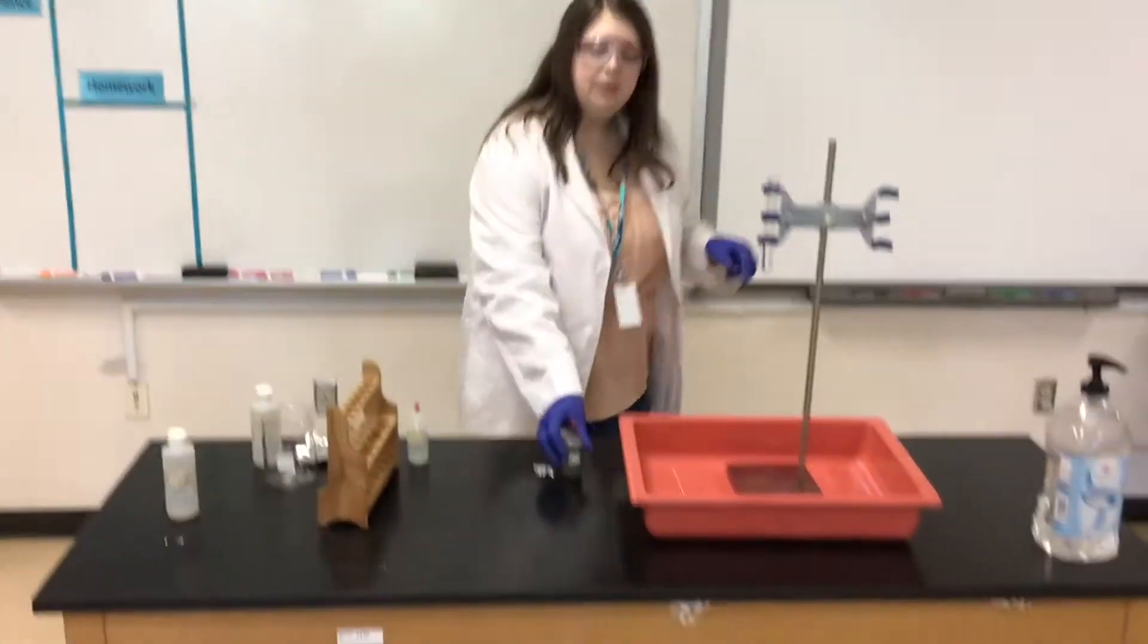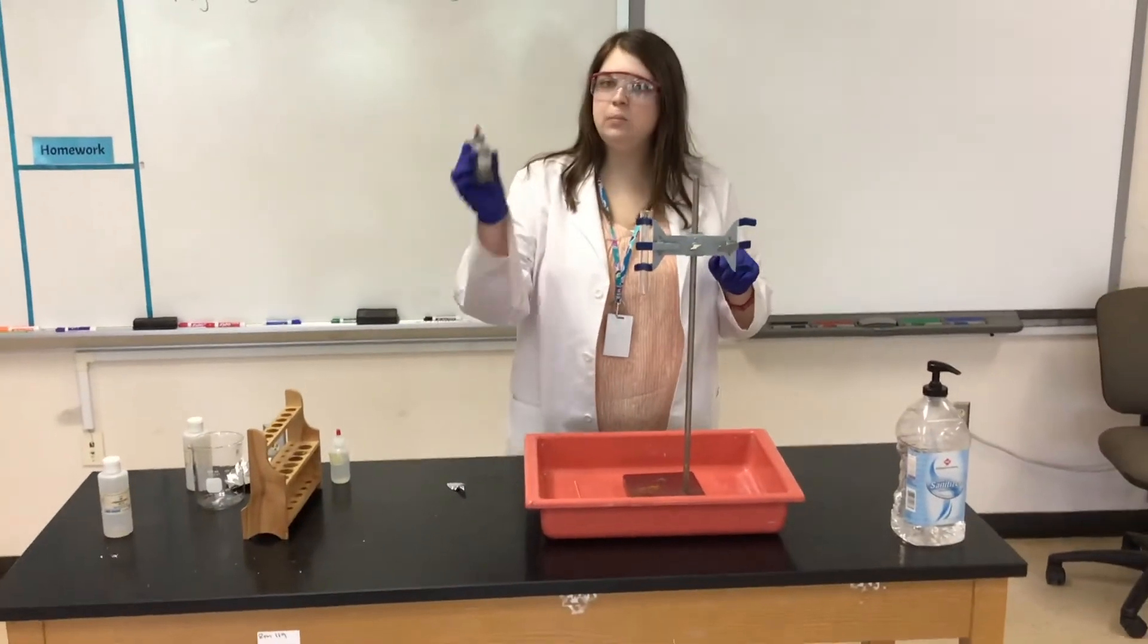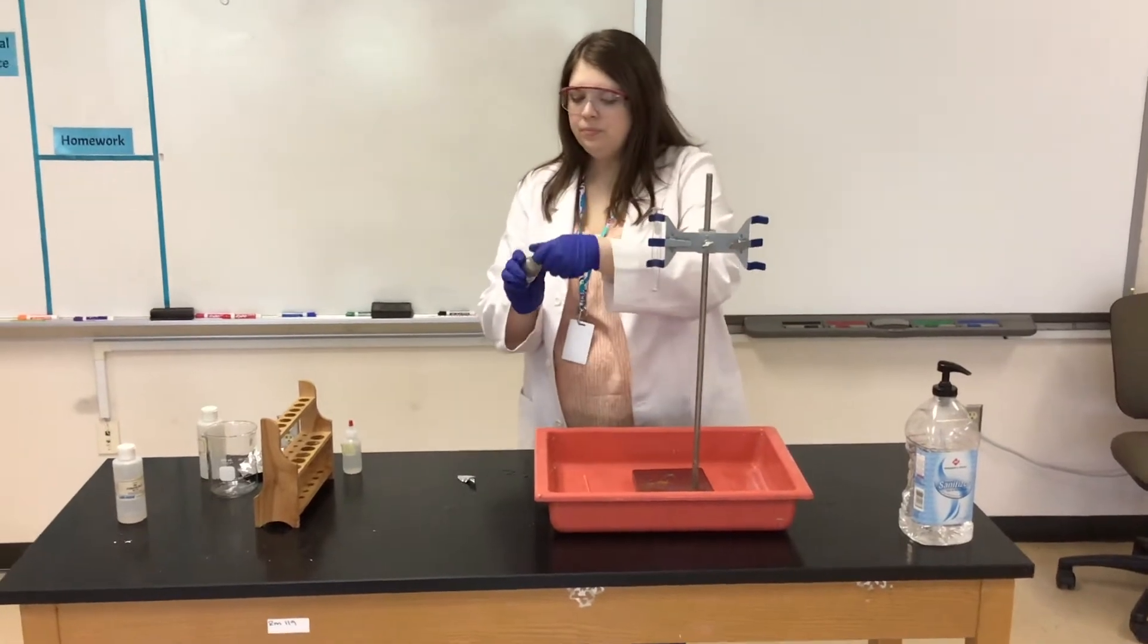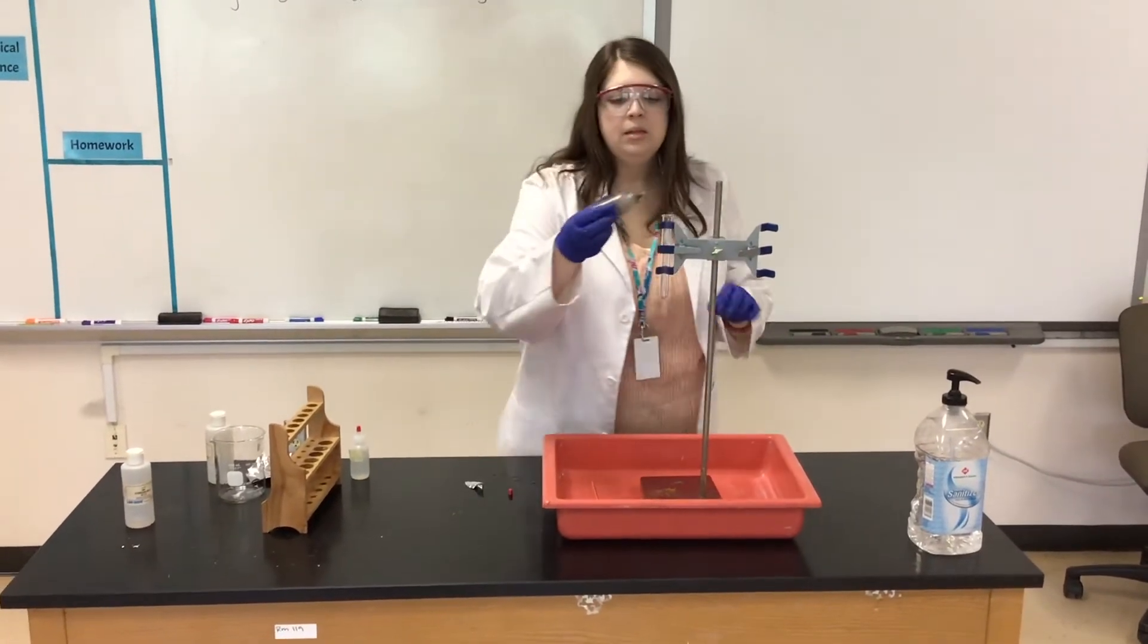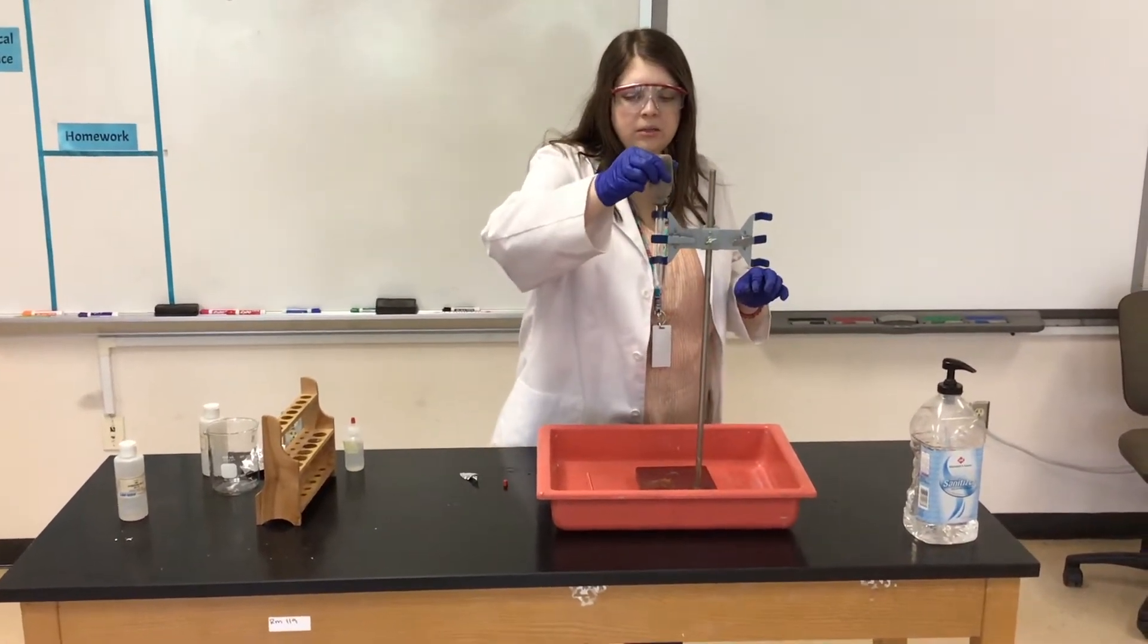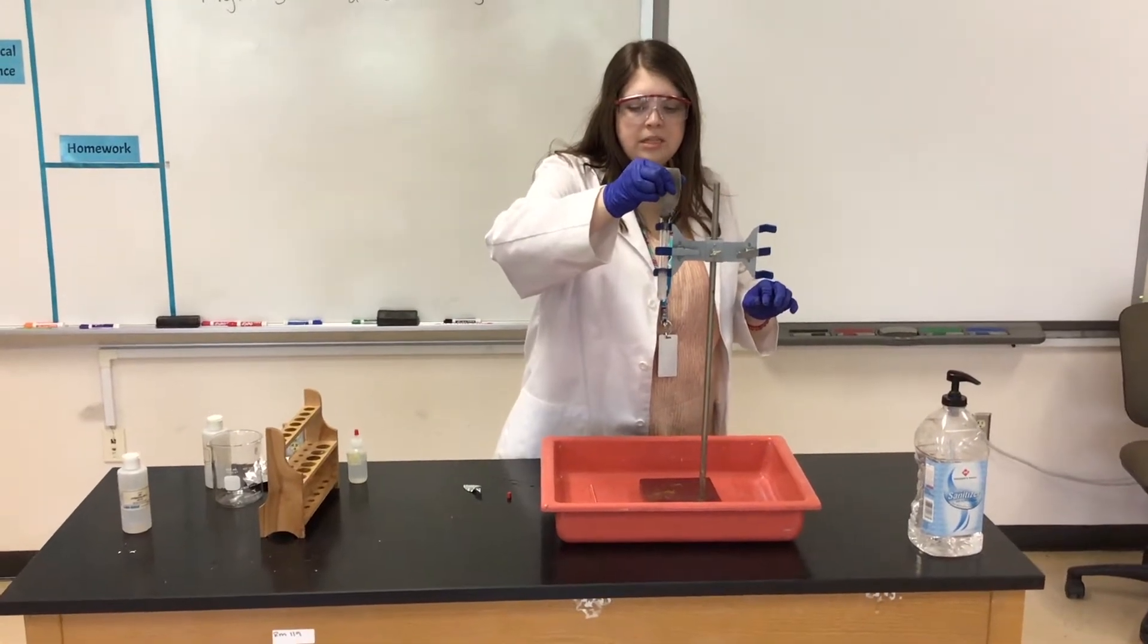Let's see this happen. First, I'm going to take some silver nitrate and put that in here - just this clear solution.